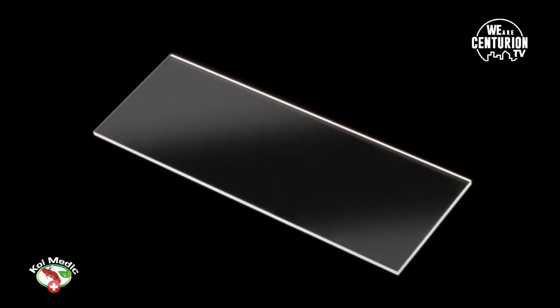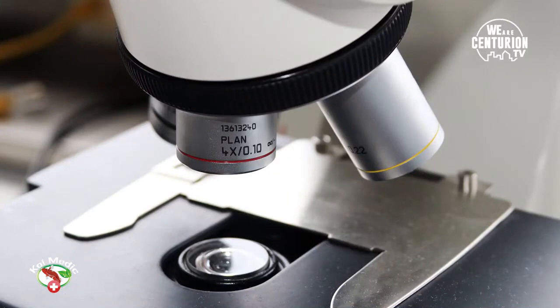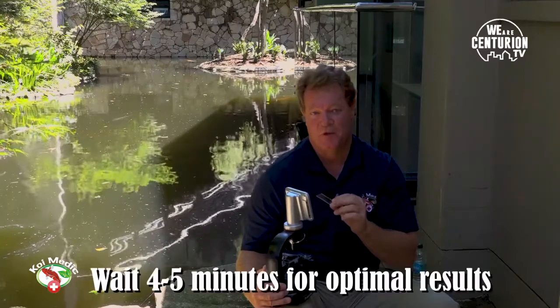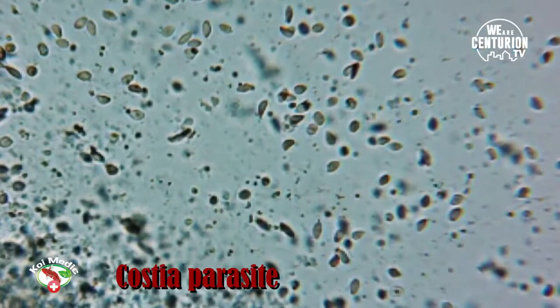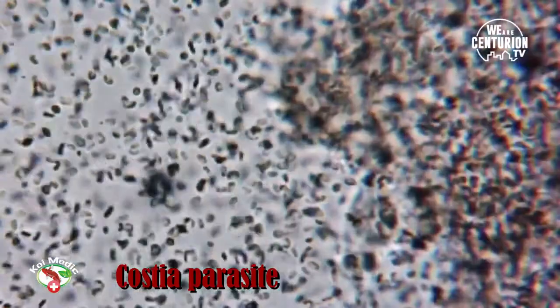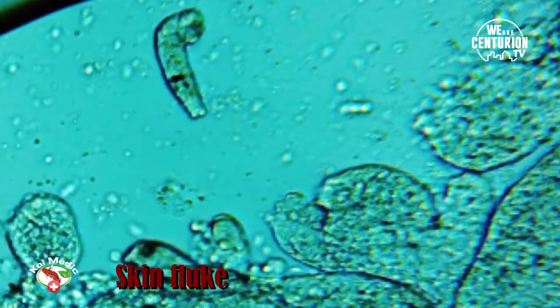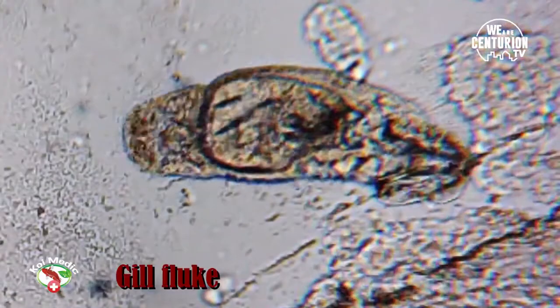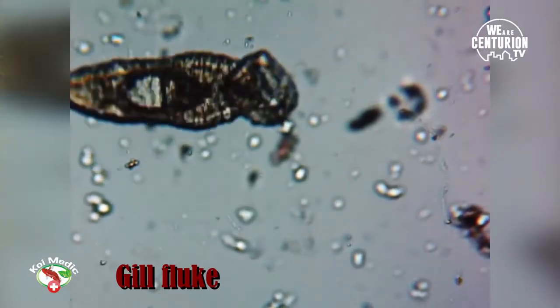In terms of microscope analysis, what's most important is technique. A lot of people take a slide, do a scrape of one fish, and immediately have a look and assess it. But you won't always find anything on the slide right away. What's very important is that you wait about four or five minutes and then put it under the microscope. By that time, any parasites will have started moving out of the mucus. A lot of mucus is itself the first telltale sign. I've come to ponds many times where I've done even two slides and picked up no parasites, but then on the third slide I have.